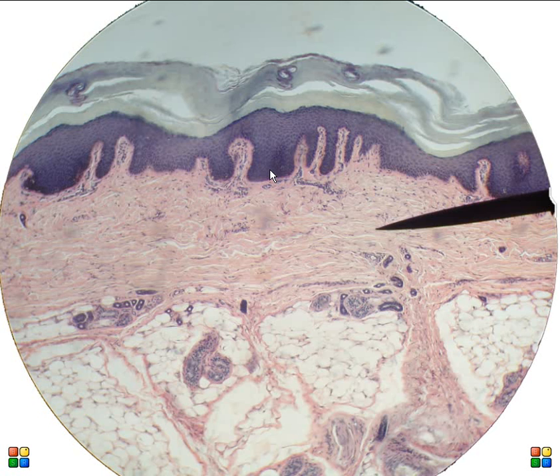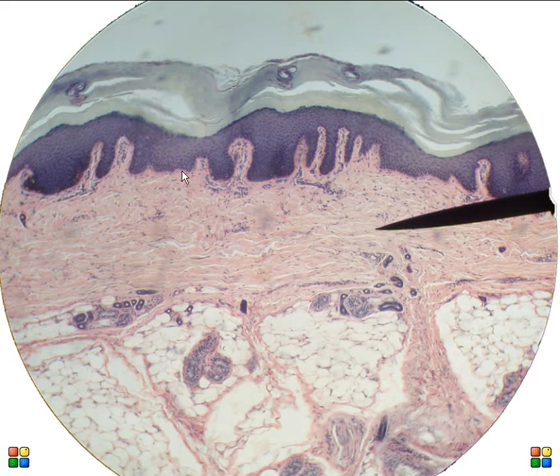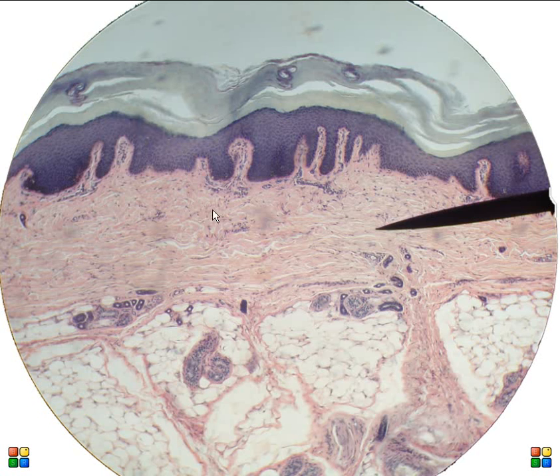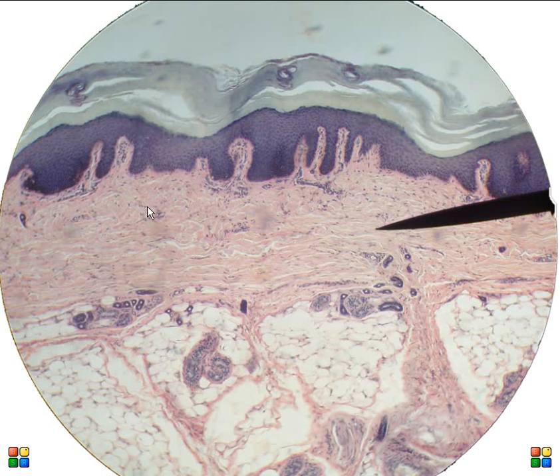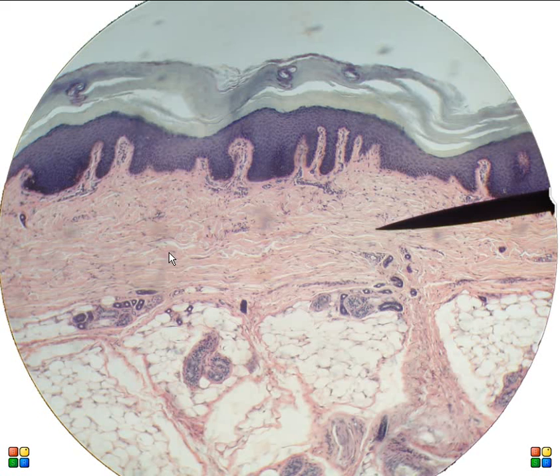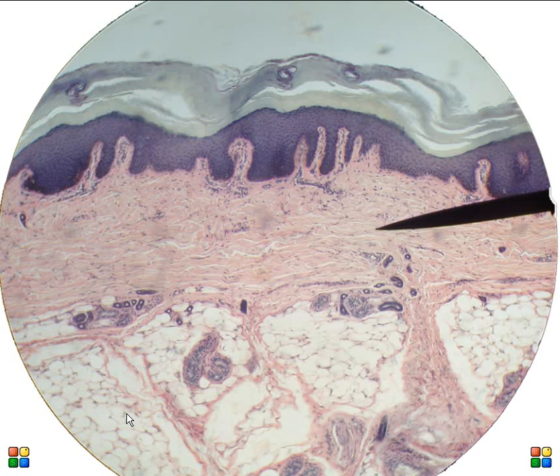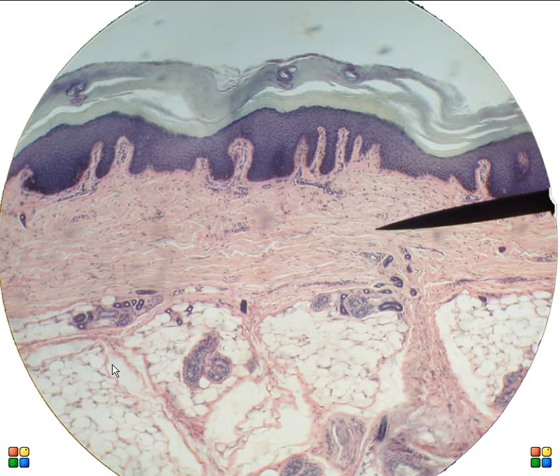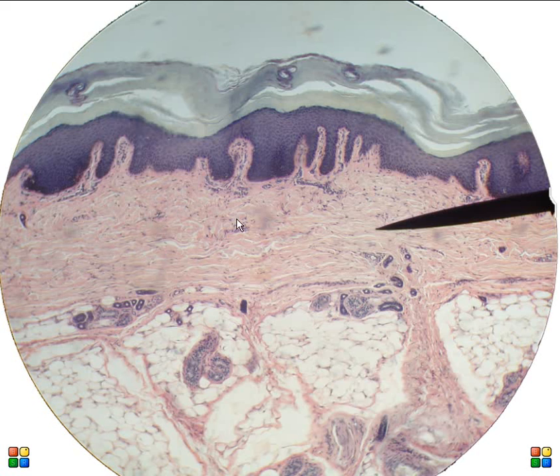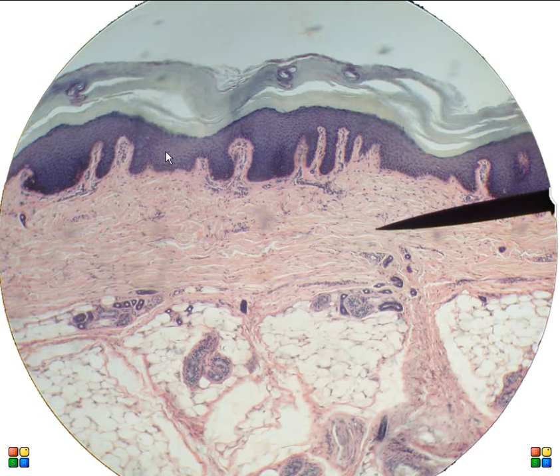This is a histological section of thick skin and you can see the major layers of skin in this image. This layer is the epidermis, starting up here at the surface and going down to the bottom of this deep purple region — all of this is epidermis. Underneath the epidermis, this lighter pink area is the dermal layer of skin, made up of dense irregular connective tissue with lots of collagen fibers and some elastic fibers to give it resiliency. Underneath the dermis we have the hypodermis or subcutaneous tissue, made up mostly of adipose tissue. So this is the hypodermis, this is the dermis which is dense irregular connective tissue, and this is the epidermis — in terms of tissue types, stratified squamous epithelium.